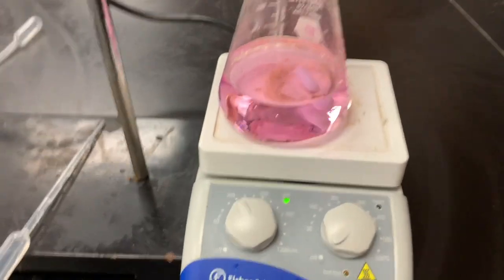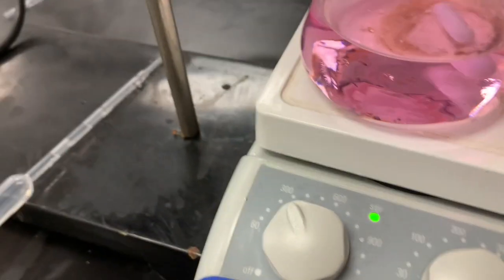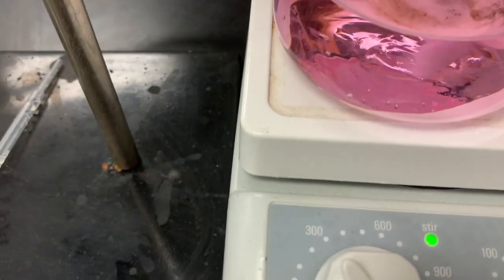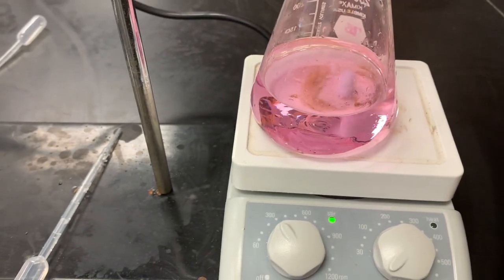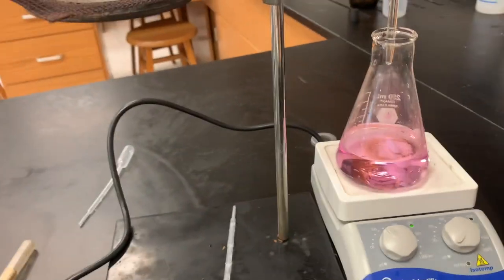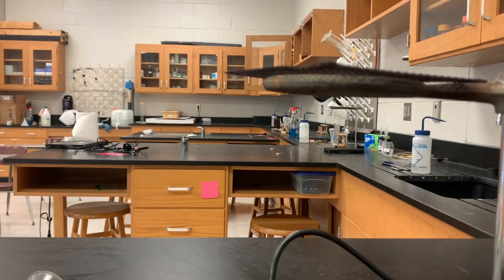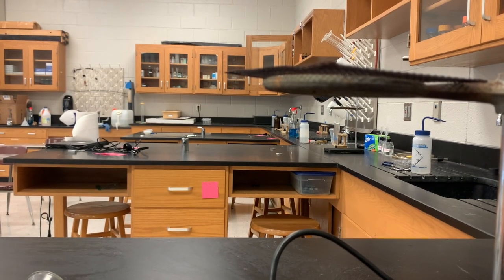I'm going to try to videotape and show you what a good titration should look like. Guys, this is what an actual titration should look like — I can do it, it just took me a minute. This very, very faint pink — where when you look over top it pretty much looks clear — this faint pink is the color that we want, which is where the actual equivalence point is. I just wanted you to see what one really looks like. We're going to still use the data collected, and since your titrations ended up looking the same, your calculation should give you the same molarity both times. Please do the math, ask any questions, and we will talk about this in class.